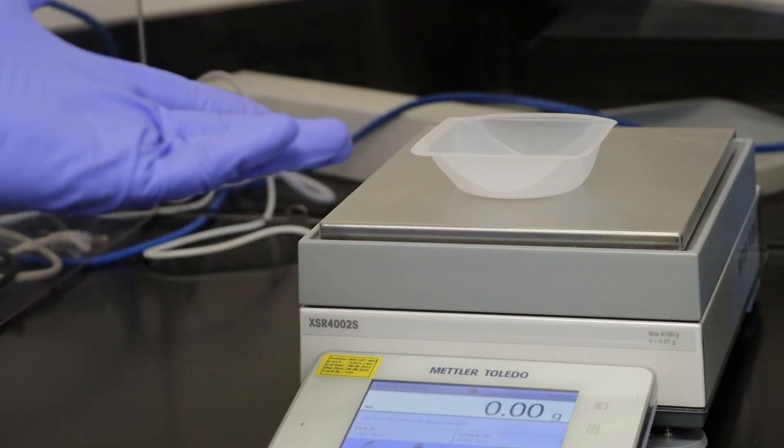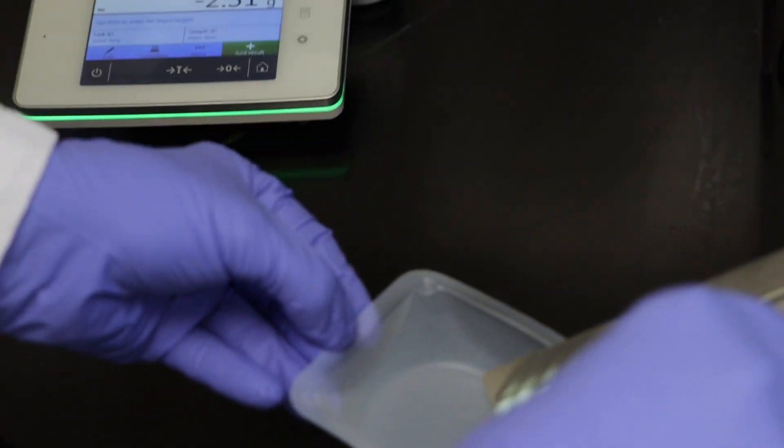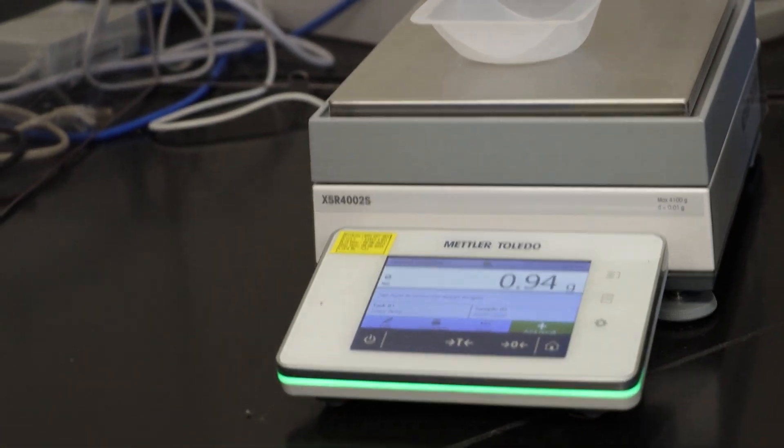We also need to get a weight on it. We're going to take our tablets, remove this weigh boat, put the tablets there, and then we're going to weigh it.